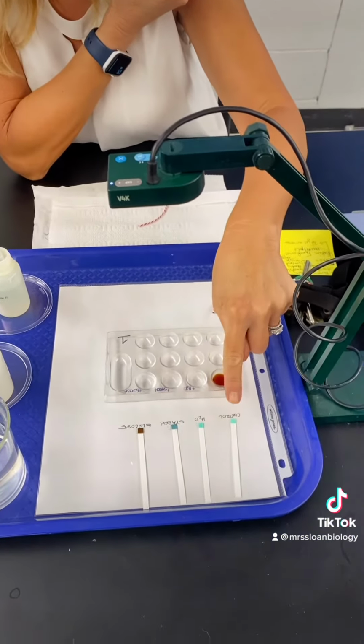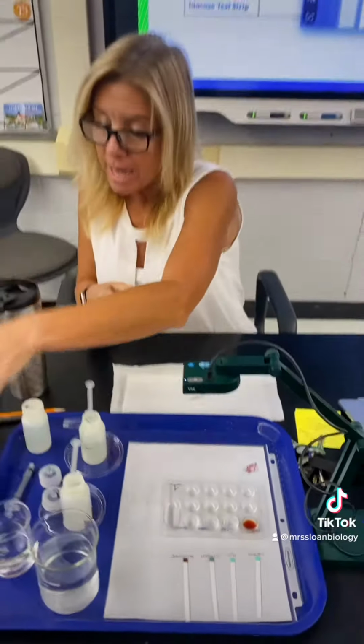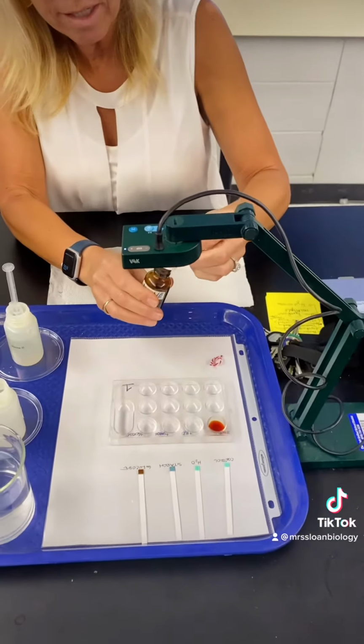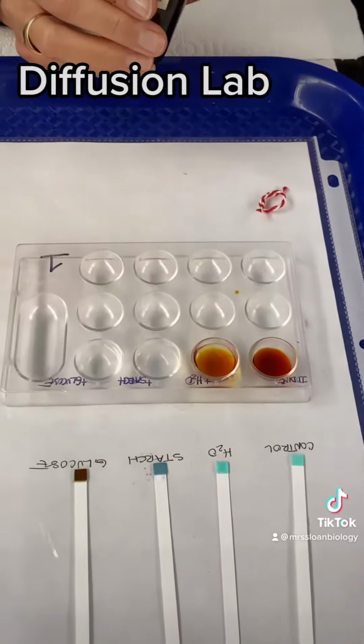I took some glucose test strips and I put, here's a control, what it normally looks like. Here's water, starch, and then I dipped the glucose test strip in the glucose and it turned that color. Now we're going to use iodine and look to see what happens. I'm mixing iodine with water. And does it look the same? Just a little more dilute.